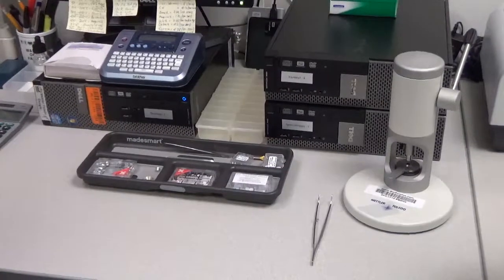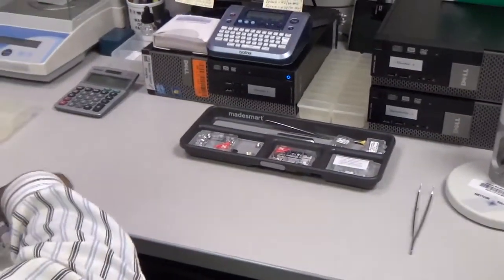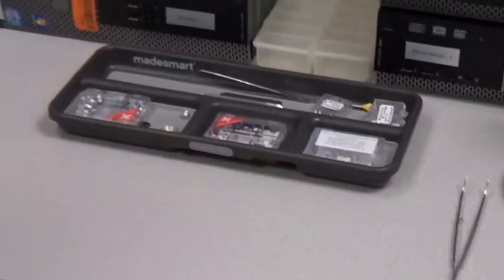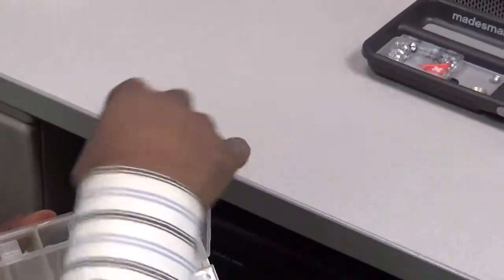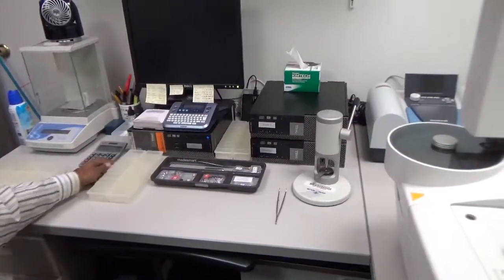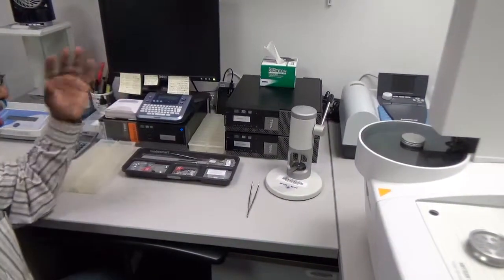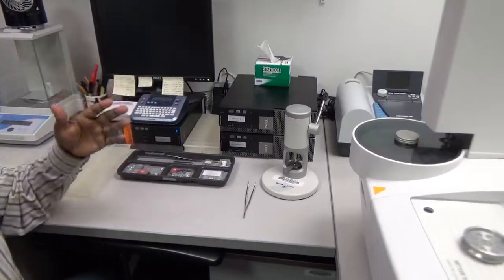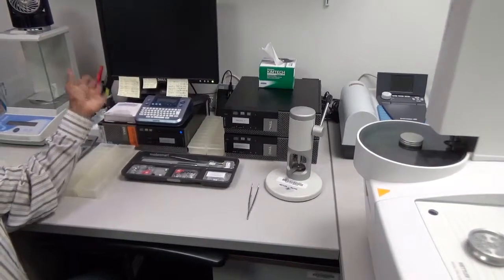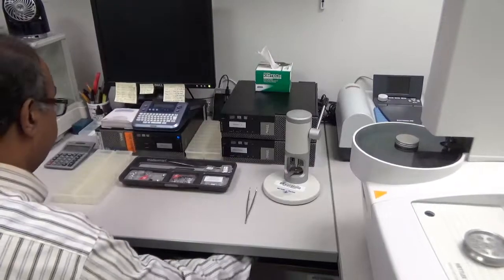Here we have different standards that we run: coarse sand, calcite, dolomite, gypsum, brucite — these are different standards. We also mix different standards to create our own standards to run. We know the known amount of mineral added and determine by TGA or DSC the amount coming out to get a good match between the known standard and the results before we run the unknown.